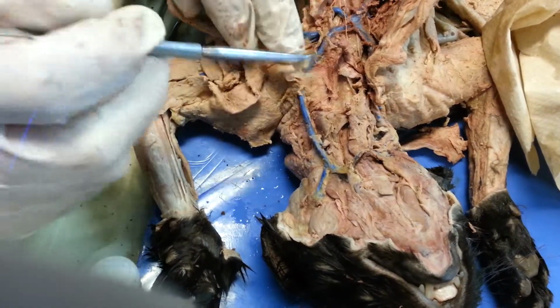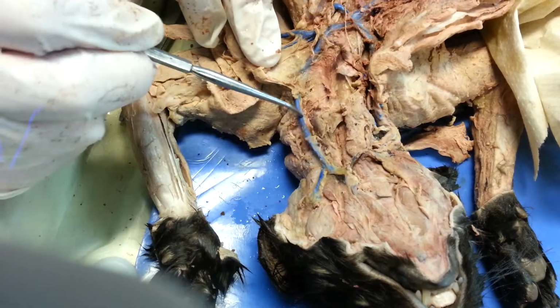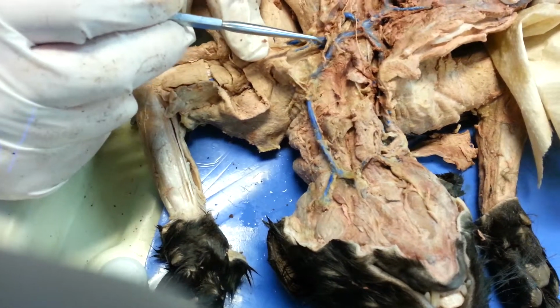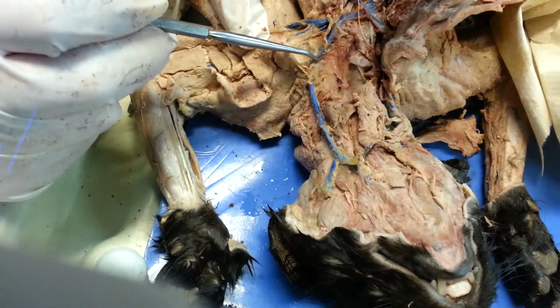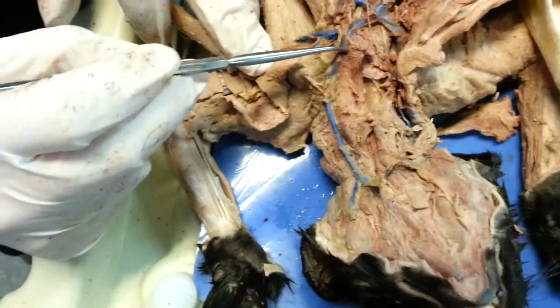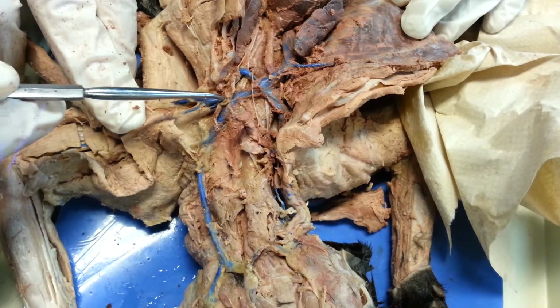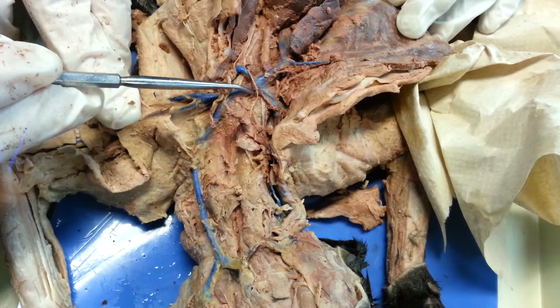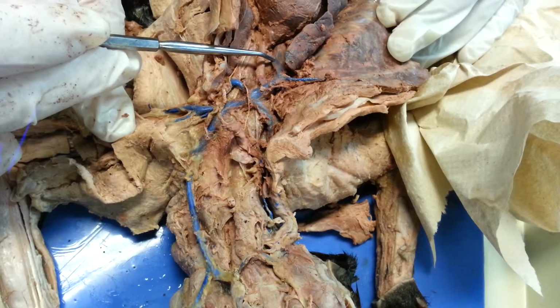But what we can see now is the jugular. This would be the common jugular by the time we get here. It's the external up here, and this is where we're going to see the other split. And down here, here's the jugular feeding in, and then it joins with the subclavian to form the brachiocephalic, which then joins with the other brachiocephalic to form the vena cava.